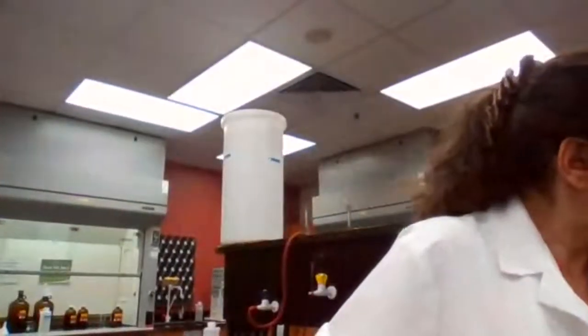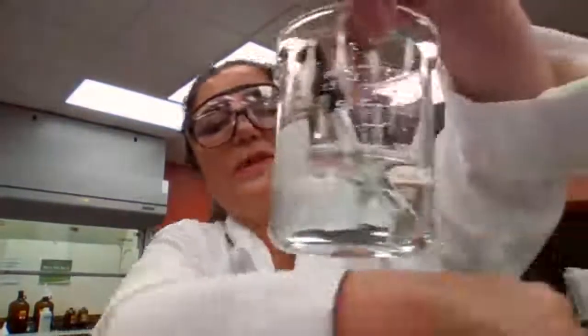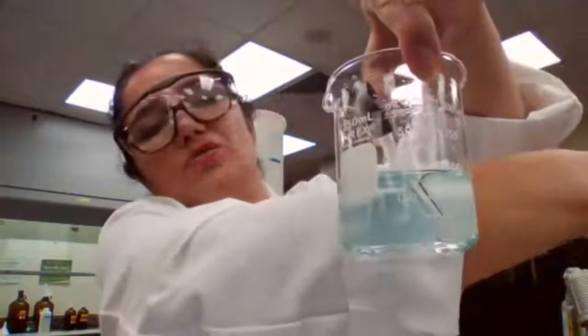color. So maybe I lost some of the copper in the form of copper sulfate, because I didn't wait long enough for the color to be completely white. It had a shade of a blue color. See this? It's not completely white. It has a shade of a blue color. It should have been white.